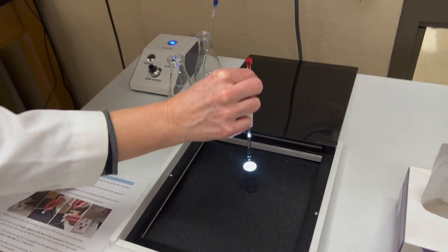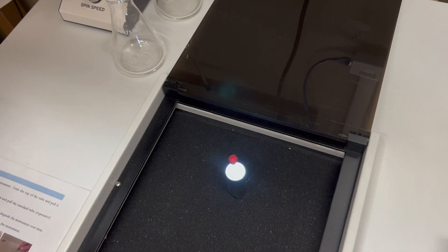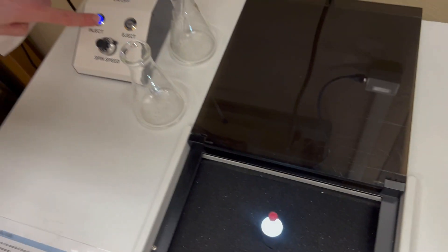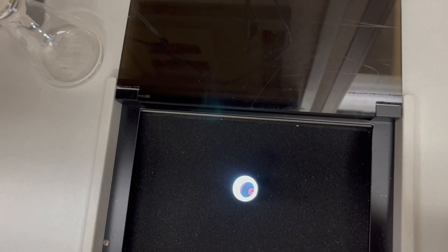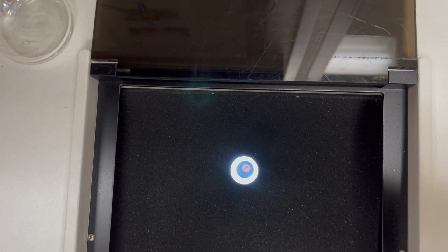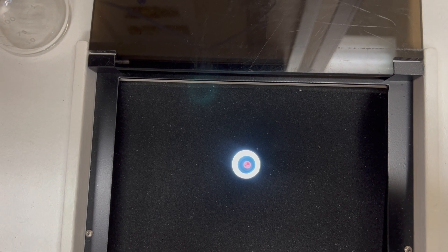You can then stick that carefully into the machine and push the inject button - that'll drop it into the NMR. One thing you want to do is look down the hatch and make sure that it is actually spinning, because there are times when it just gets stuck.